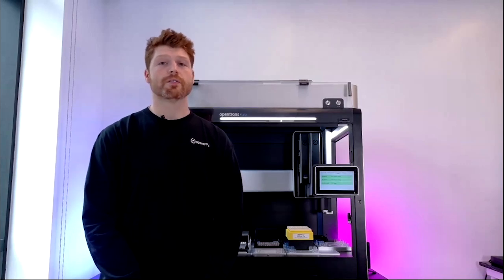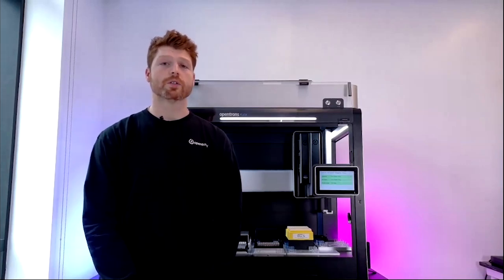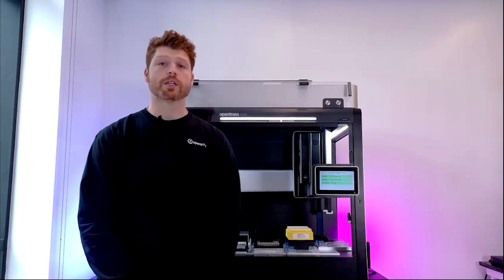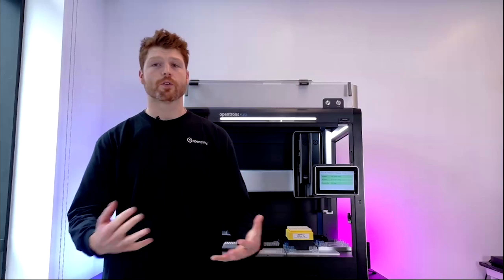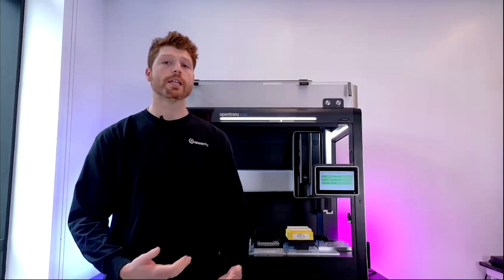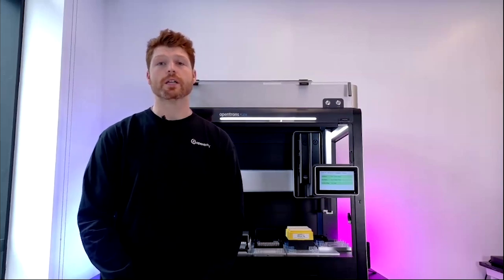To find the protocol that fits our needs, we can search, or we have a pretty extensive filtering toolset, which allows us to browse based on a category such as application. Today, I'm going to be showing you a trypsin-based digestion, and there are going to be several that pop up. I'll show you how to filter through those to find the one that best fits your needs and the relevant robot information that you'll have.